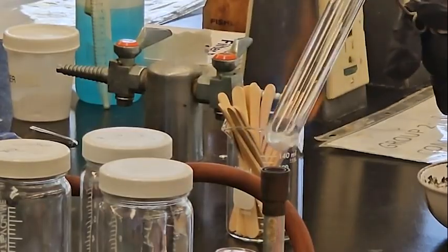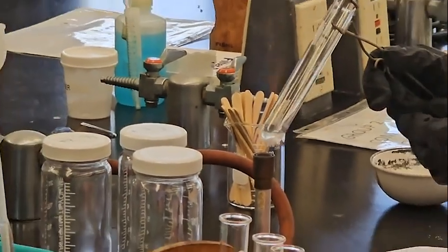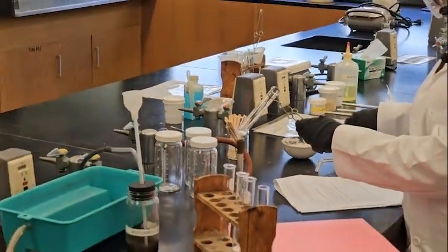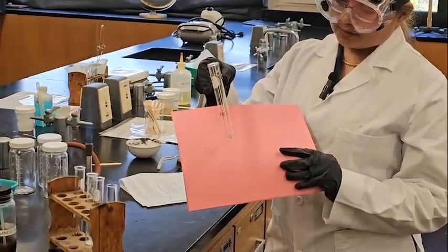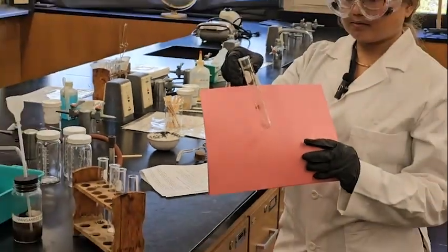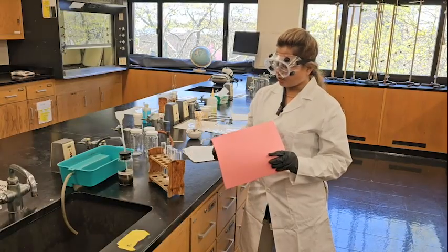Okay, in the meantime, I showed you in a reaction that we are going to produce sodium nitrite. So now this time I can see it was solid, white. Now the state of matter changed from solid to liquid, right? You can see. The next one I will show you the oxygen. Is the gas oxygen or not?